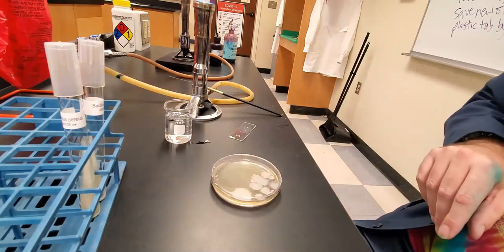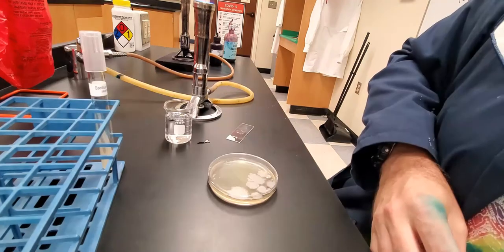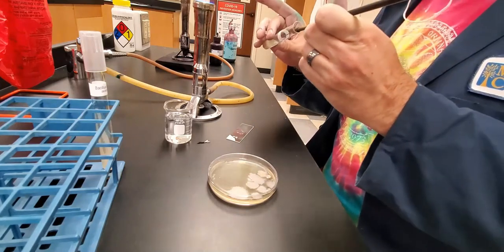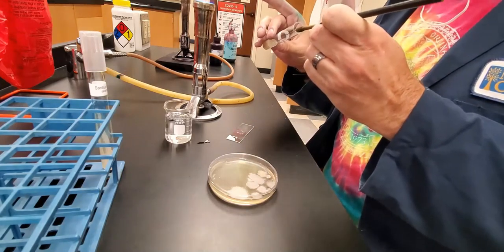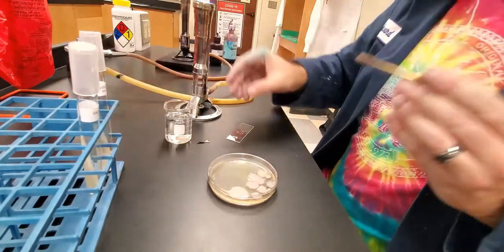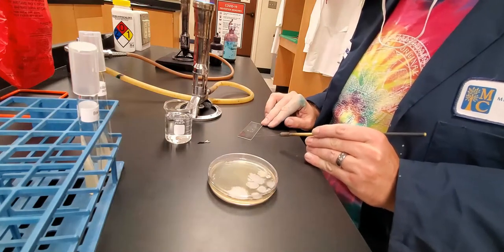Here's my last one. Just a reminder: aseptic technique, sterile loop, flame the lip of your glass, flame it again, put the lid back on. Then we can go in and finish making our smear with the last of those cells.